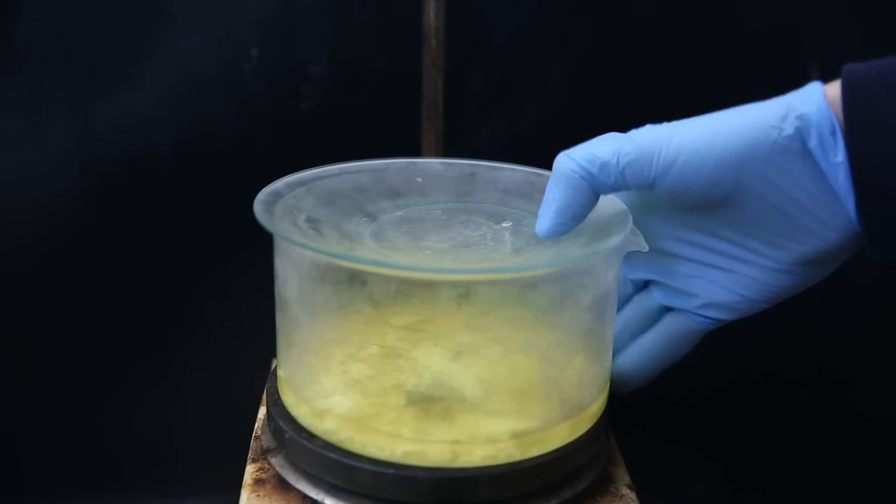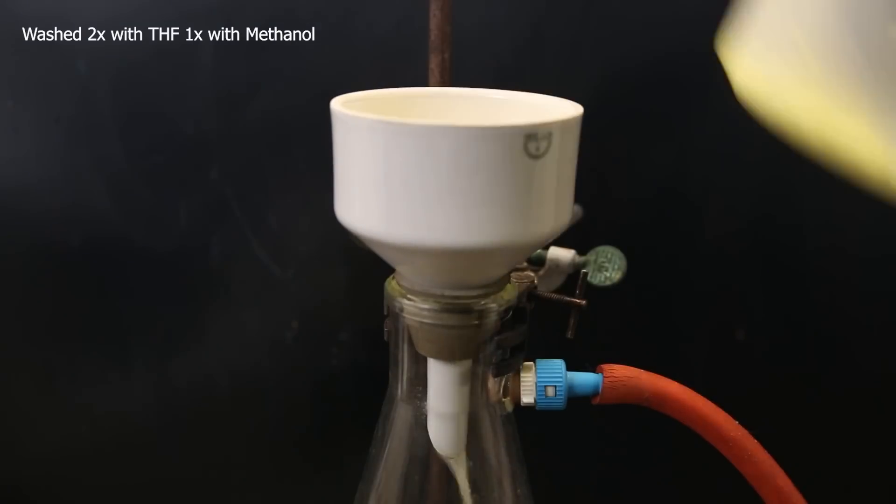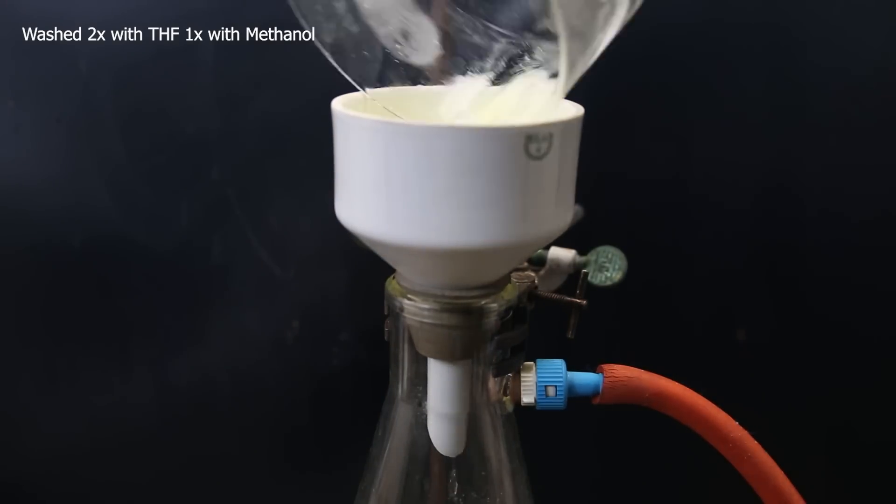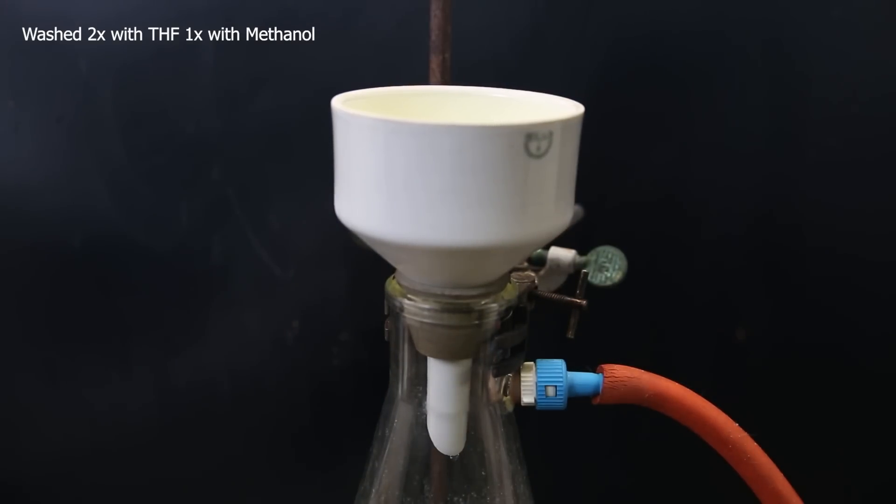Afterward, the product has crystallized as a bright yellow solid, and I collect it with vacuum filtration. I wash it twice with THF, and then once with methanol, and let it dry on the filter for a second.